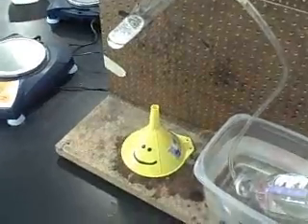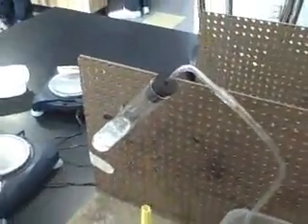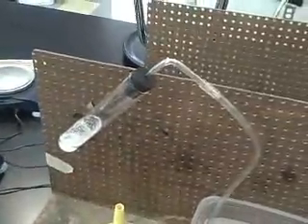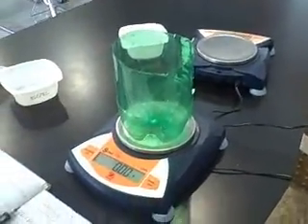Now we have to collect data. We're back again! Jason will pull out the rubber stopper out of the test tube, as well as the collector tube out of the stopper. He is now massing the half-liter bottle.